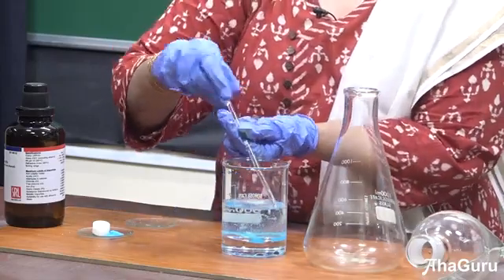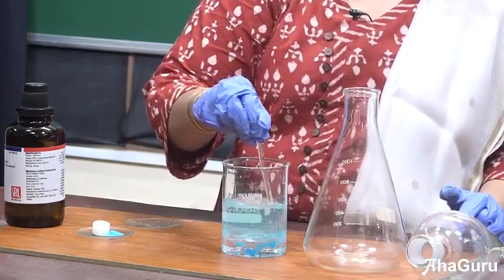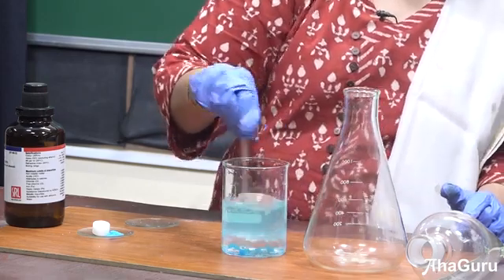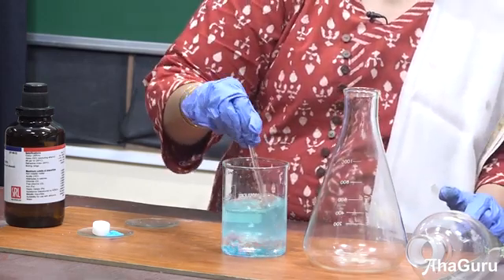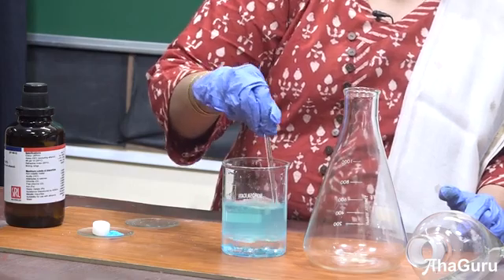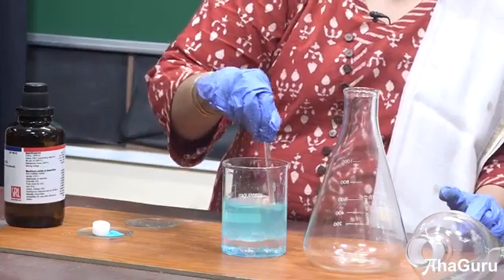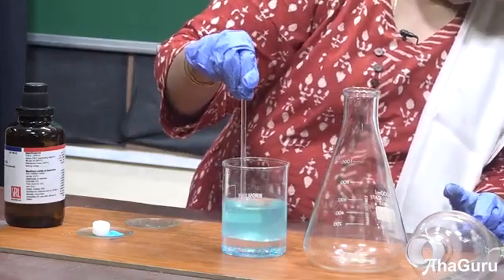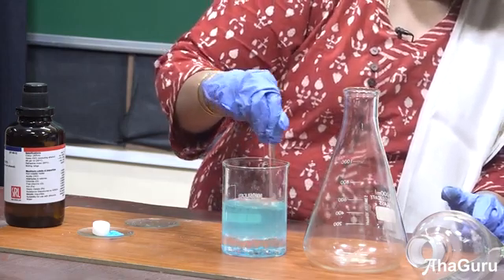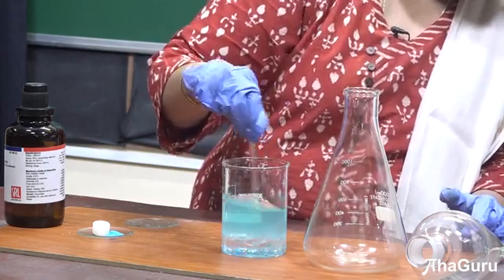Copper sulfate will be soluble in water and the organic compound, which is naphthalene, will be soluble in chloroform. I am going to stir it completely. You can see that naphthalene is soluble in chloroform and copper sulfate is soluble in water. You can see the top layer which is water is now turning blue because copper sulfate is getting dissolved in water.